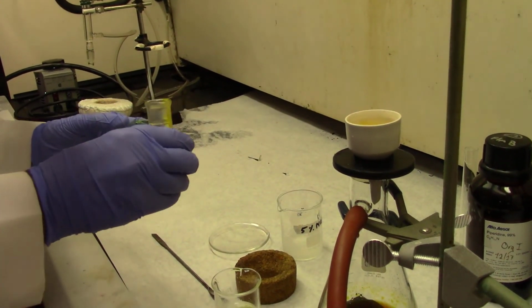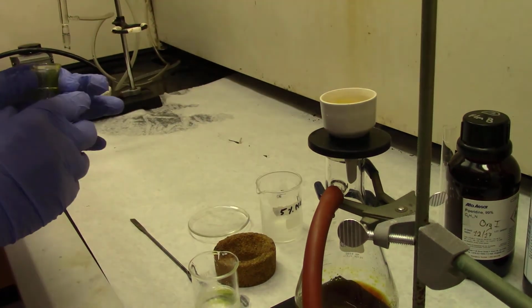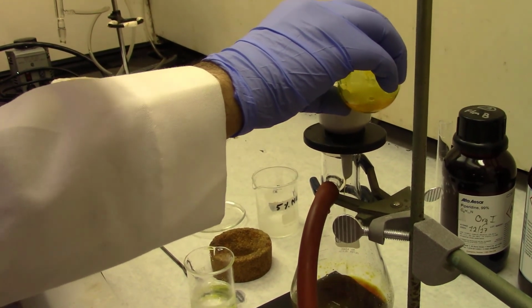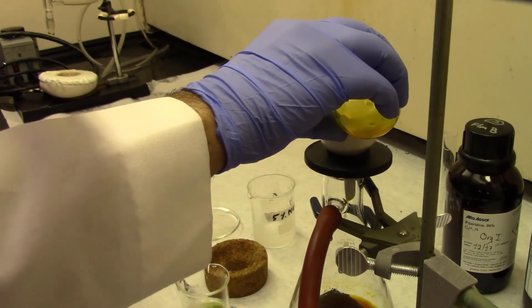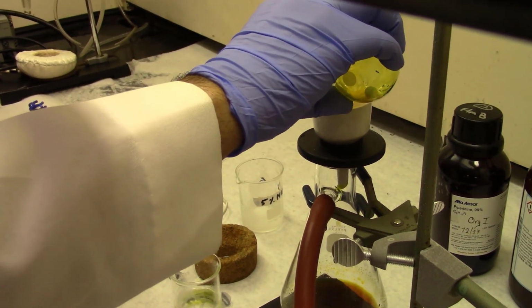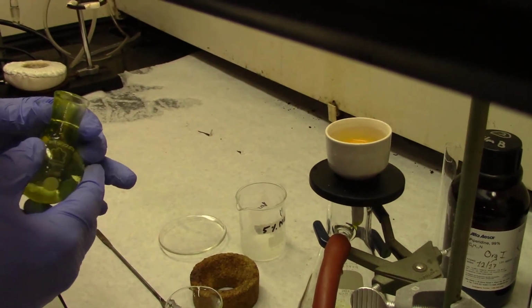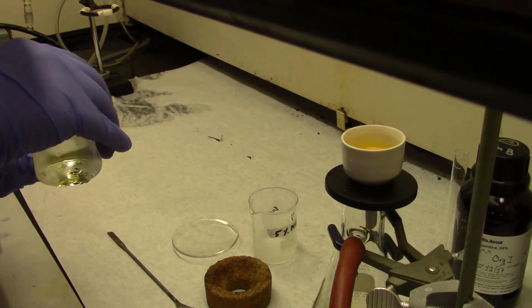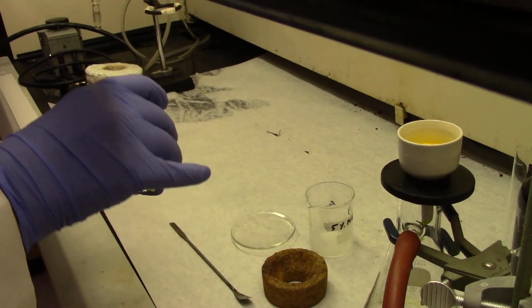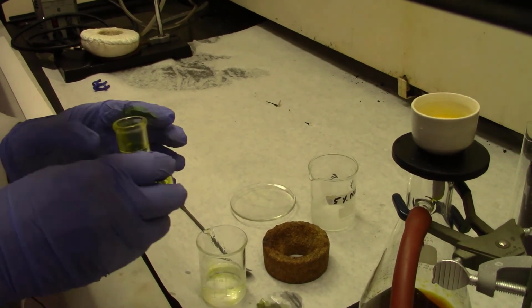The purpose is now to actually stop the filtration and add the rinse to it. Add the rinse and agitate it a little bit, make a circular motion, make sure all the crystals are completely covered by the rinse, and you keep it there for about maybe half a minute, and just assume that the crystals have been washed to some extent, and then turn the vacuum on again. And when you turn the vacuum on again, the rinse goes into the filtrate.